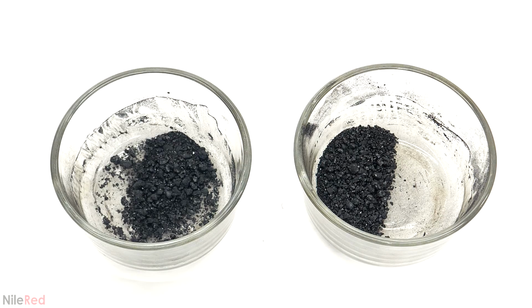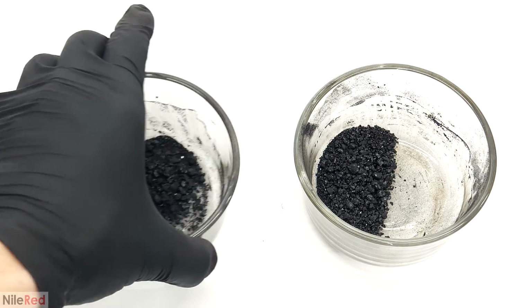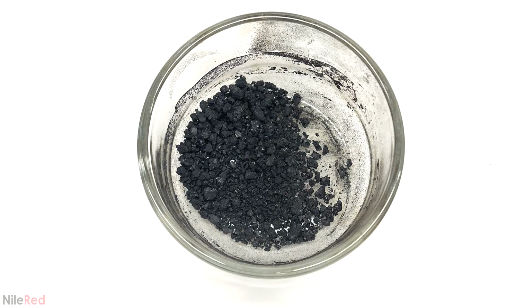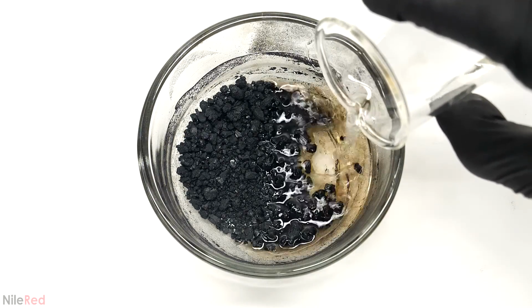To make things easier, I split the batch roughly in half because I found that mixing large amounts can be a bit of a pain. For this half, I first weighed it, and it came out to be about 12 grams. I found that a good amount of kerosene to add is 85% of this mass, so I added 10.2 grams.